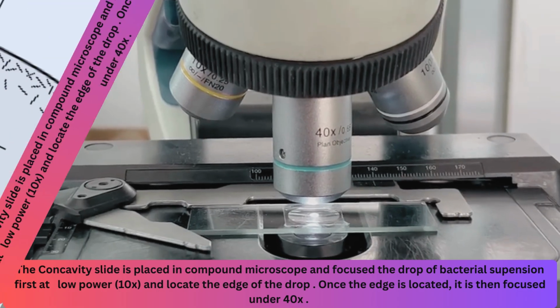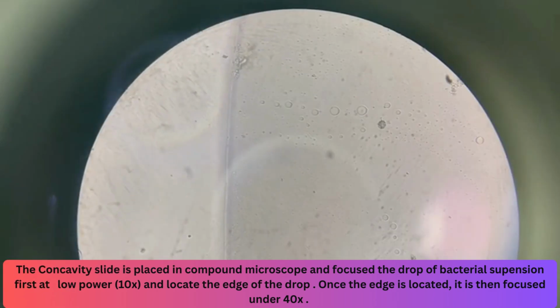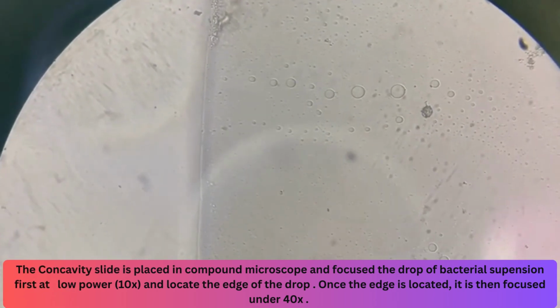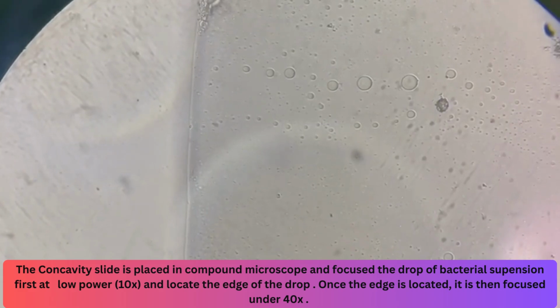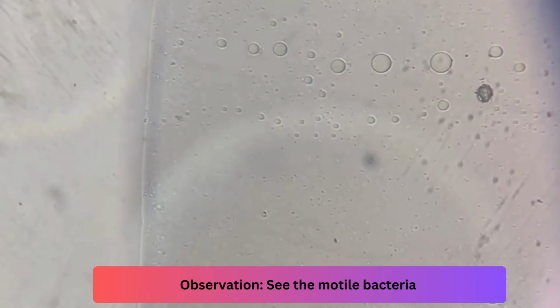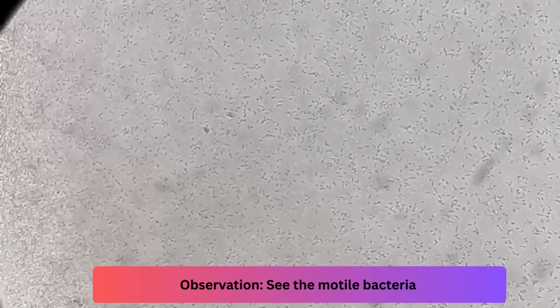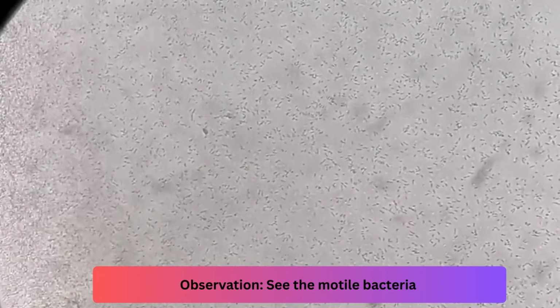first at lower power, 10x, and locate the edge of the drop. Once you have located the edge of the drop, then turn the objective to high power, 40x. Focus on the edge of the drop carefully and look at each side of that line for very small rod or spherical shaped objects, which are the bacteria. If the bacteria are motile, you will see them moving.